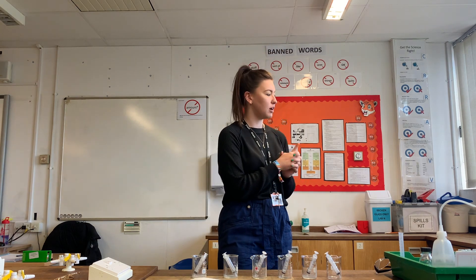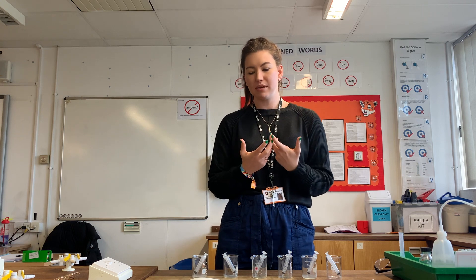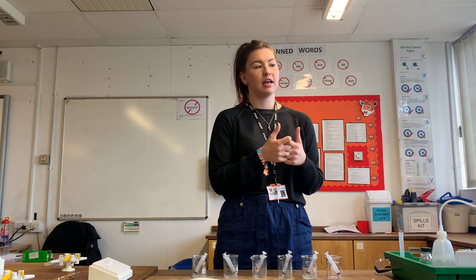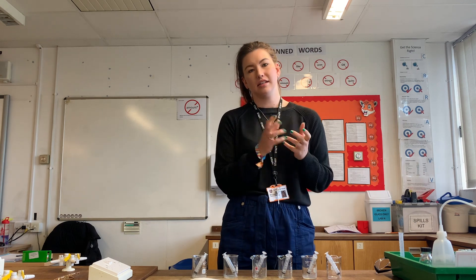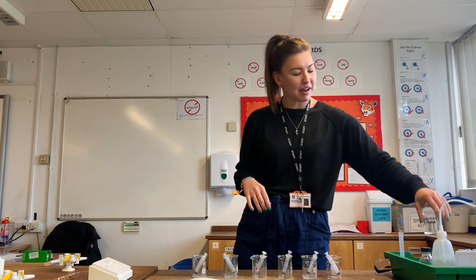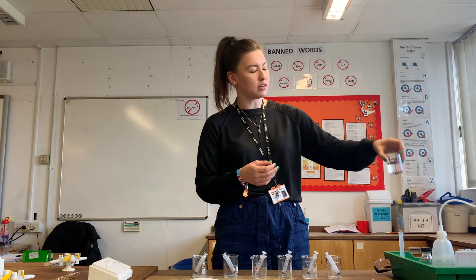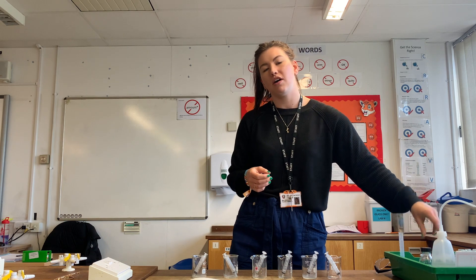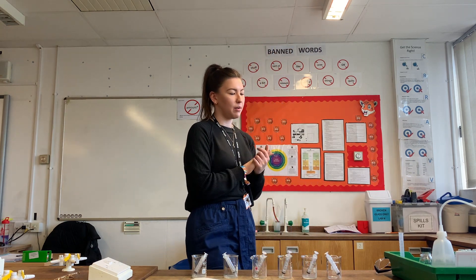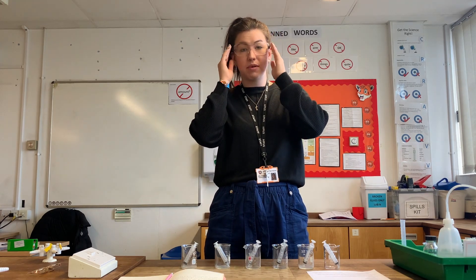By popping our samples into a colorimeter, that will give us some actual number data. We will then plot our concentration data against our colorimeter data to give us a nice graph. We'll also have been doing the Benedict's test and the colorimeter readings for our unknown glucose concentration, and we'll be able to use our graph to read off the glucose concentration for our unknown.